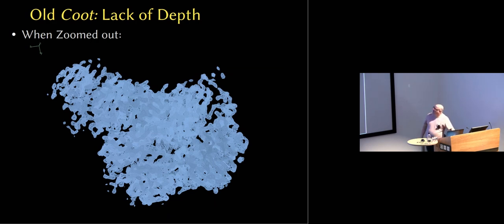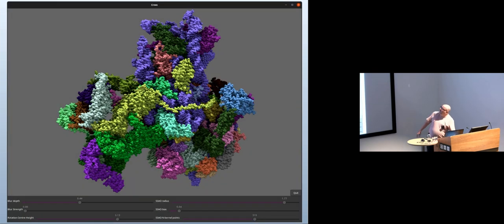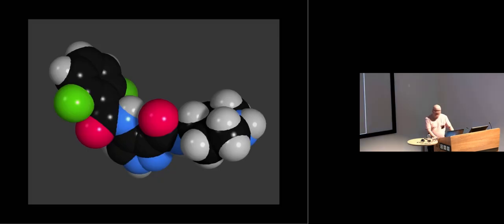They look more like that, and old Coot was terrible at displaying reconstructions, and for good reason, people use Chimera and ChimeraX to do so. So this is Coot's new render engine, and already you can see that there's an improvement. Now you can see that the structure is made of atoms, but when we add the post-processing extra lighting effects, you can see hopefully that the configuration and juxtaposition of the components of this ribosome particle here are rather more readily apparent than they were in the naive lighting scheme.